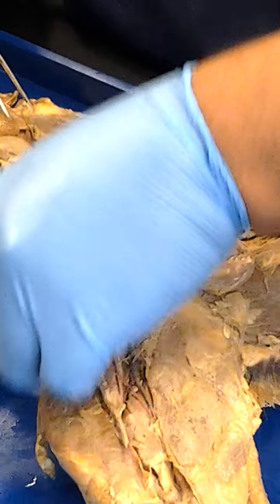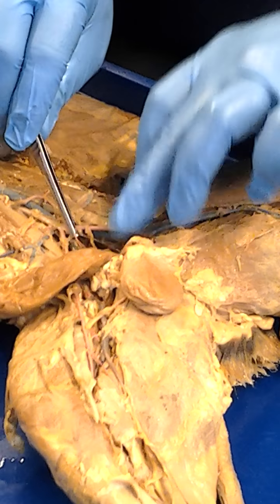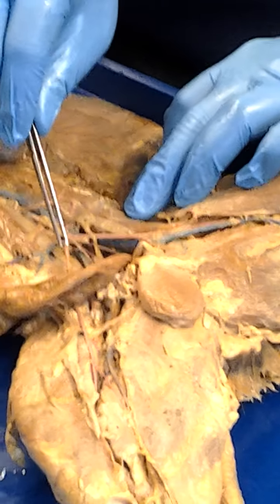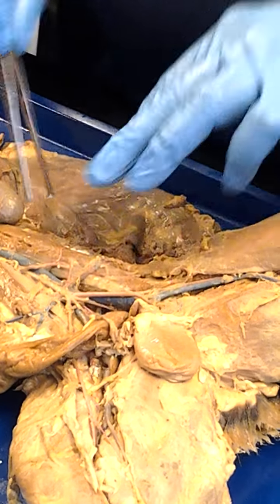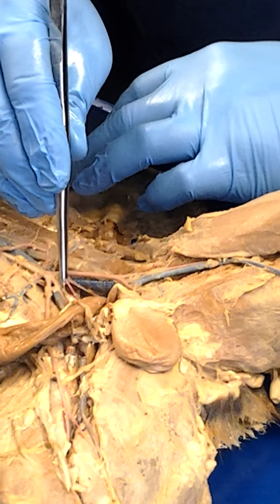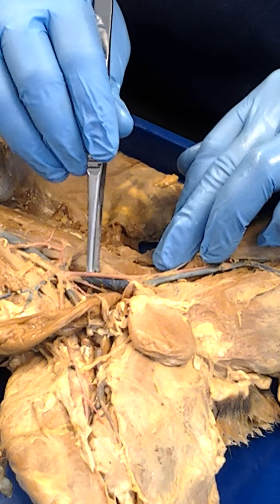Okay? We're going to flip this back over this way, and we're going to see that there's another blood vessel right here, a little thin one. See that little tiny one right there? That's the internal right there. Here's the internal. So here's the external, here's the internal. Then, right in the center right here, right there is the median sacral. Right there. So then, we keep on going.